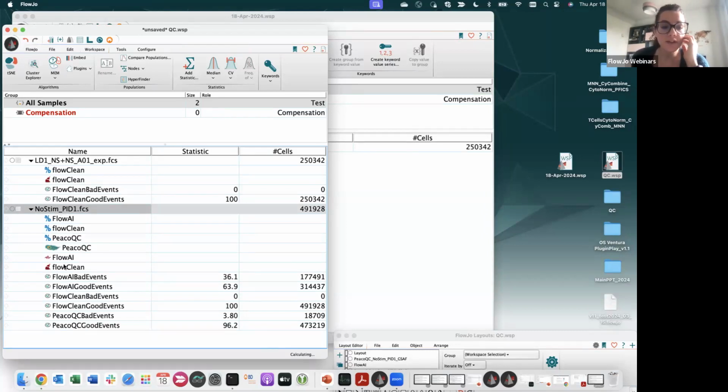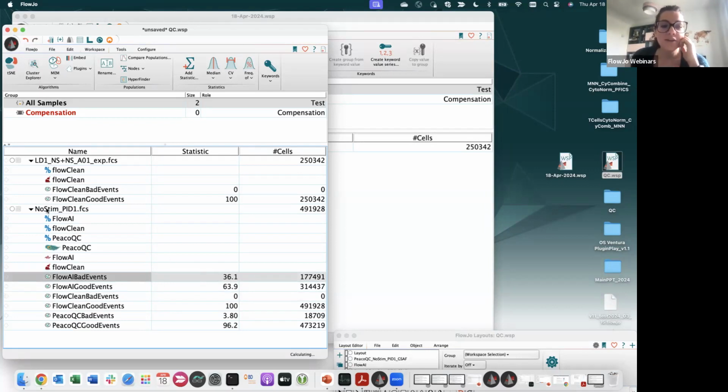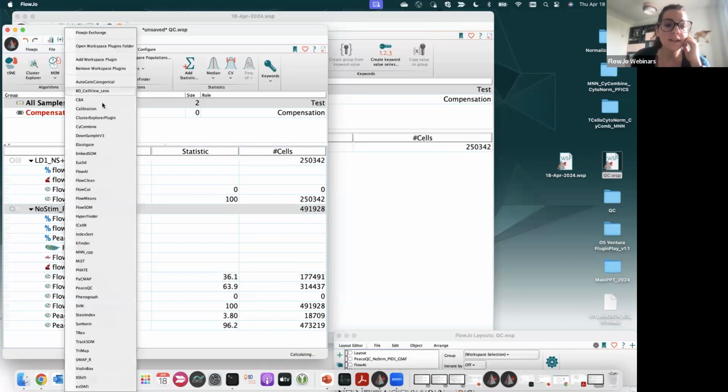So in this case, you see the outputs from all of them. I ran FlowClean and I had 0% removal. I ran FlowAI and I had 36% removal. When I ran PeacoQC, I had 3.8% removal of events. Now, to run PeacoQC, you will need to download and install that separately.